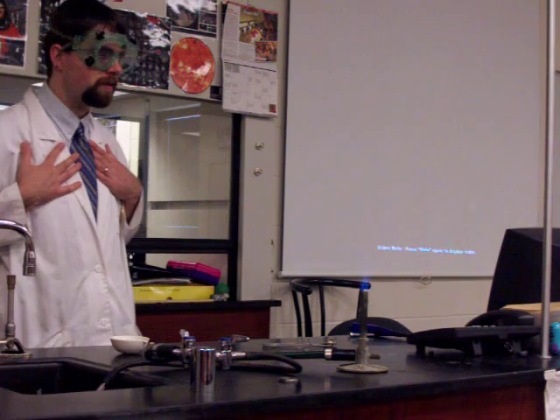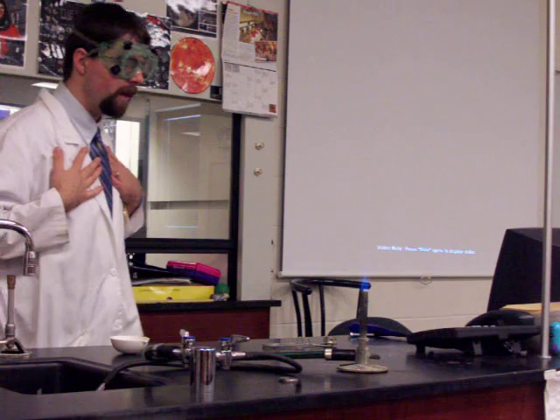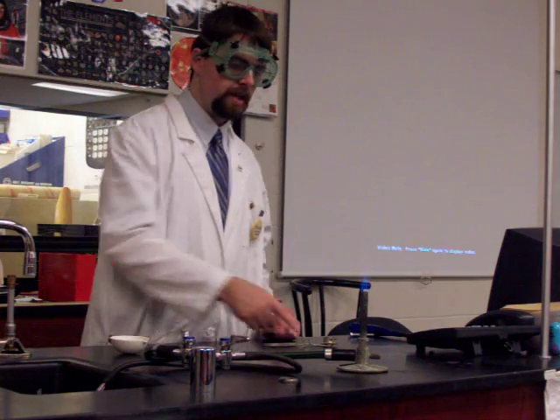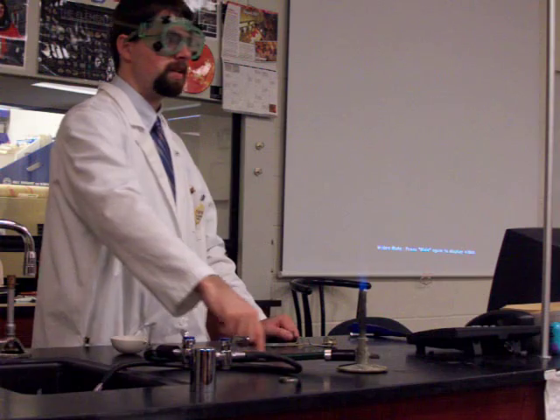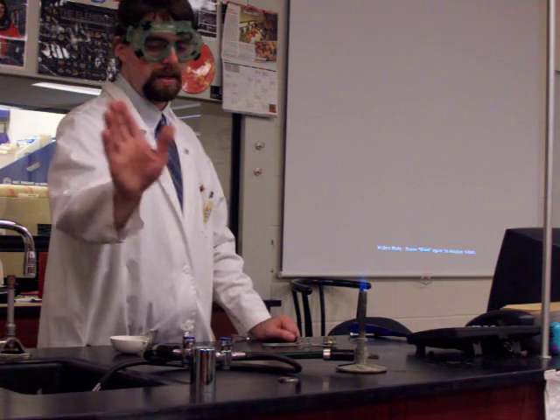I will also point out that, of course, I have on a lab coat. You'll have on aprons as well as goggles just to keep yourself safe around this. On occasion, the gas will ignite early down here. The flames will go down the tube and it will light here. Or you will notice that it is burning somewhere here in the tube. If that does happen, turn it off here if you can.